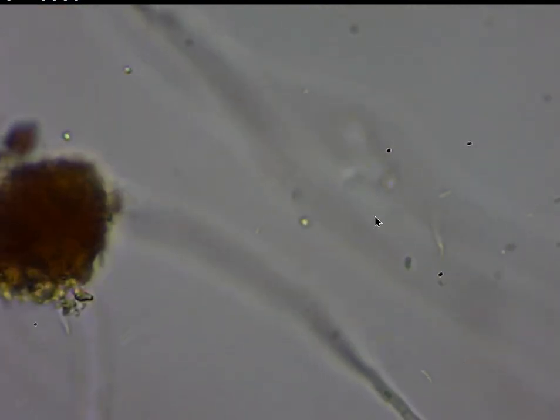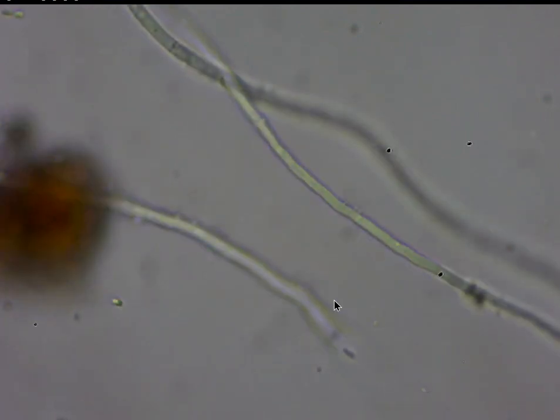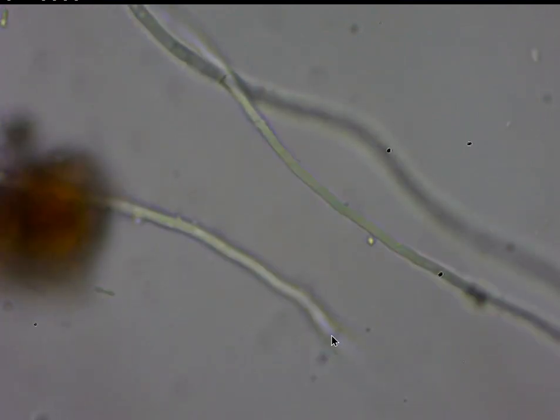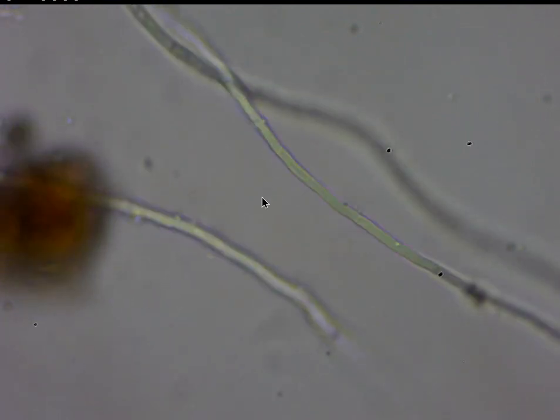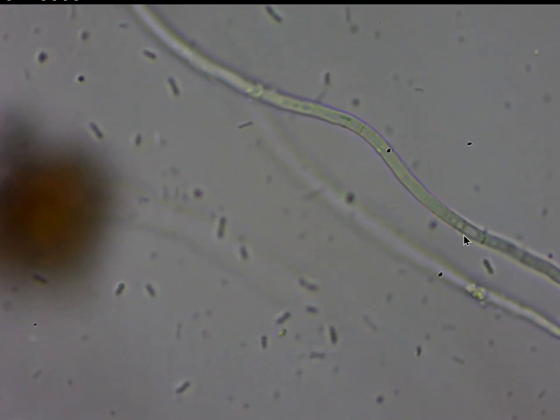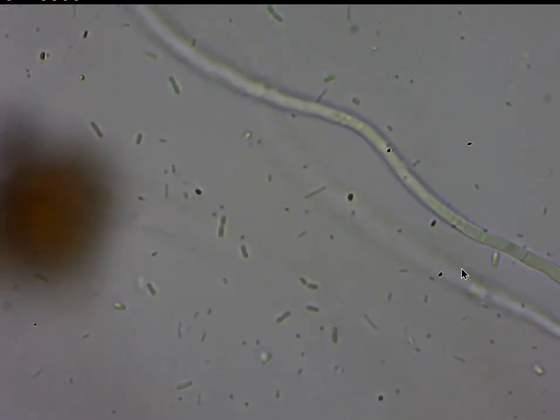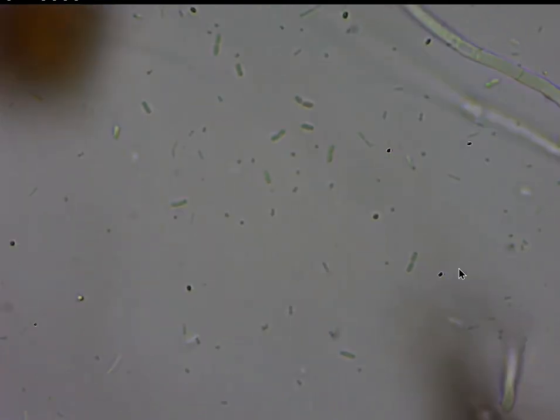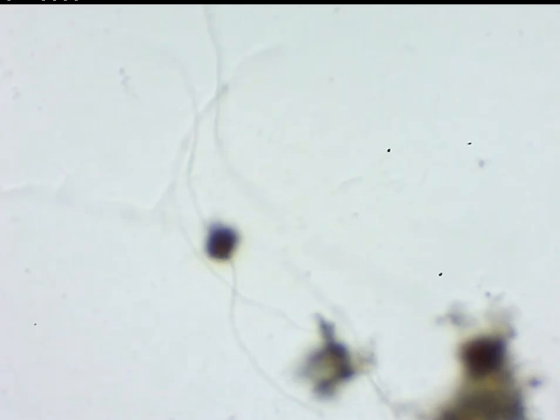There seems to be some septa there — separation — which is what you look for in fungal hyphae. I'd be surprised if it wasn't beneficial.